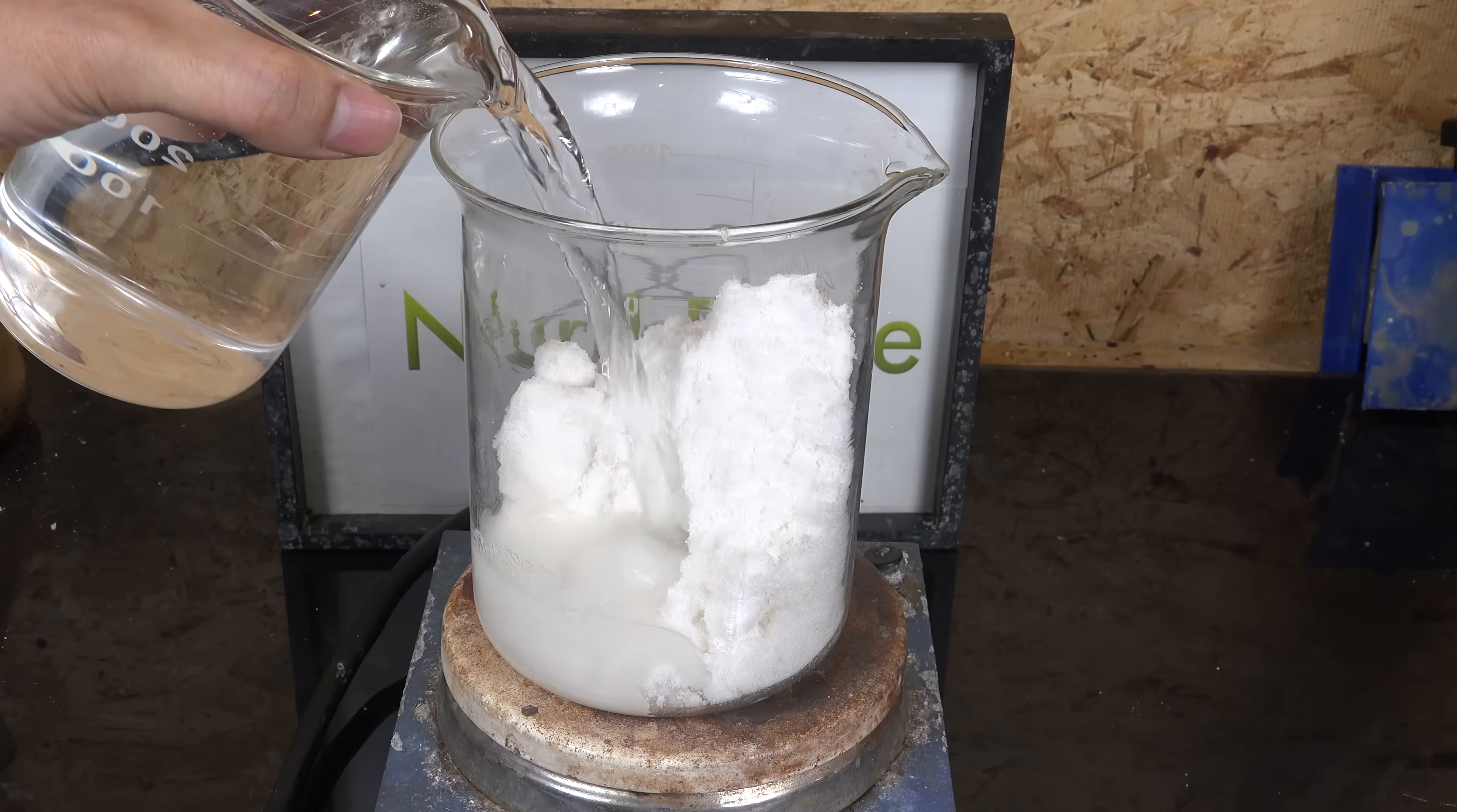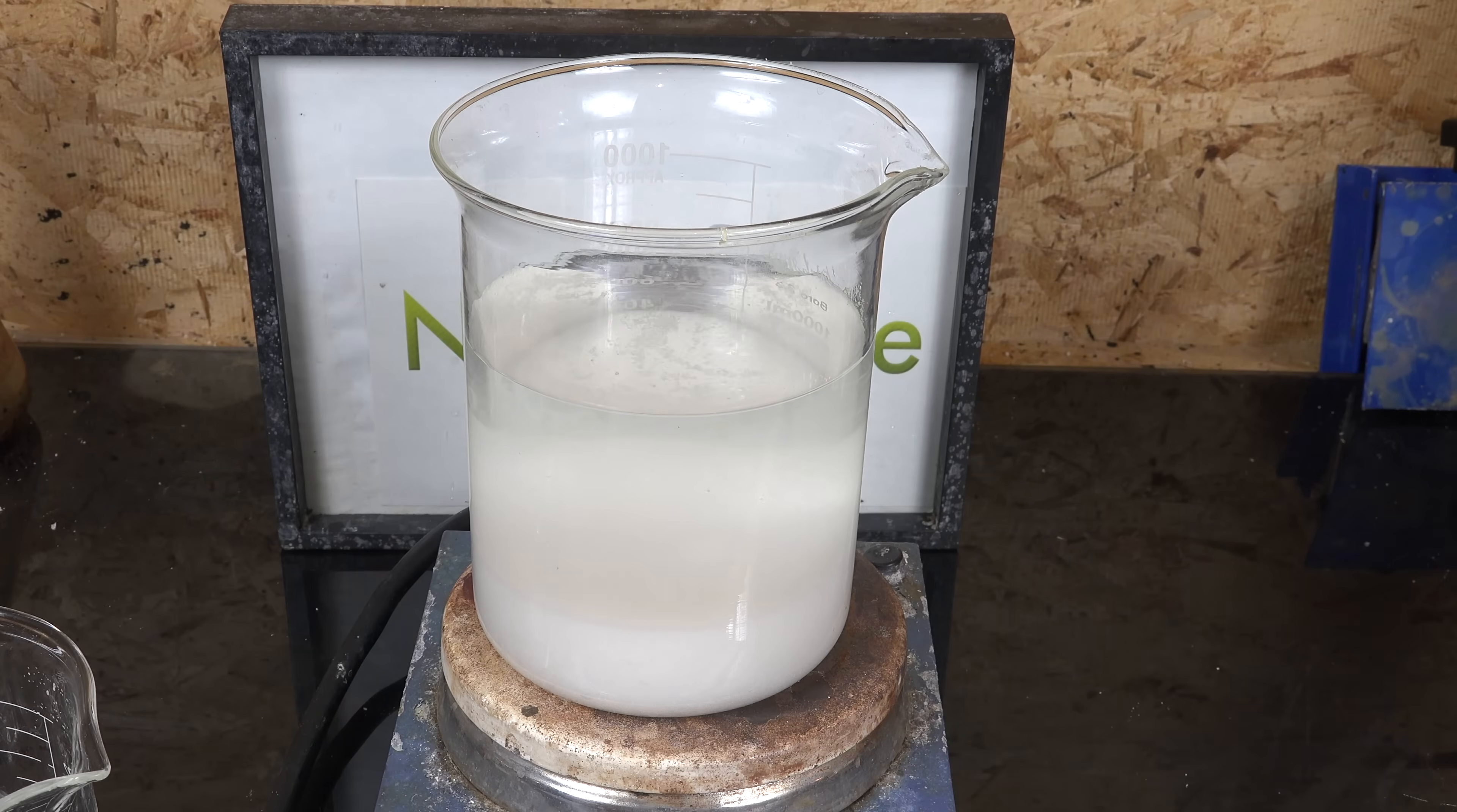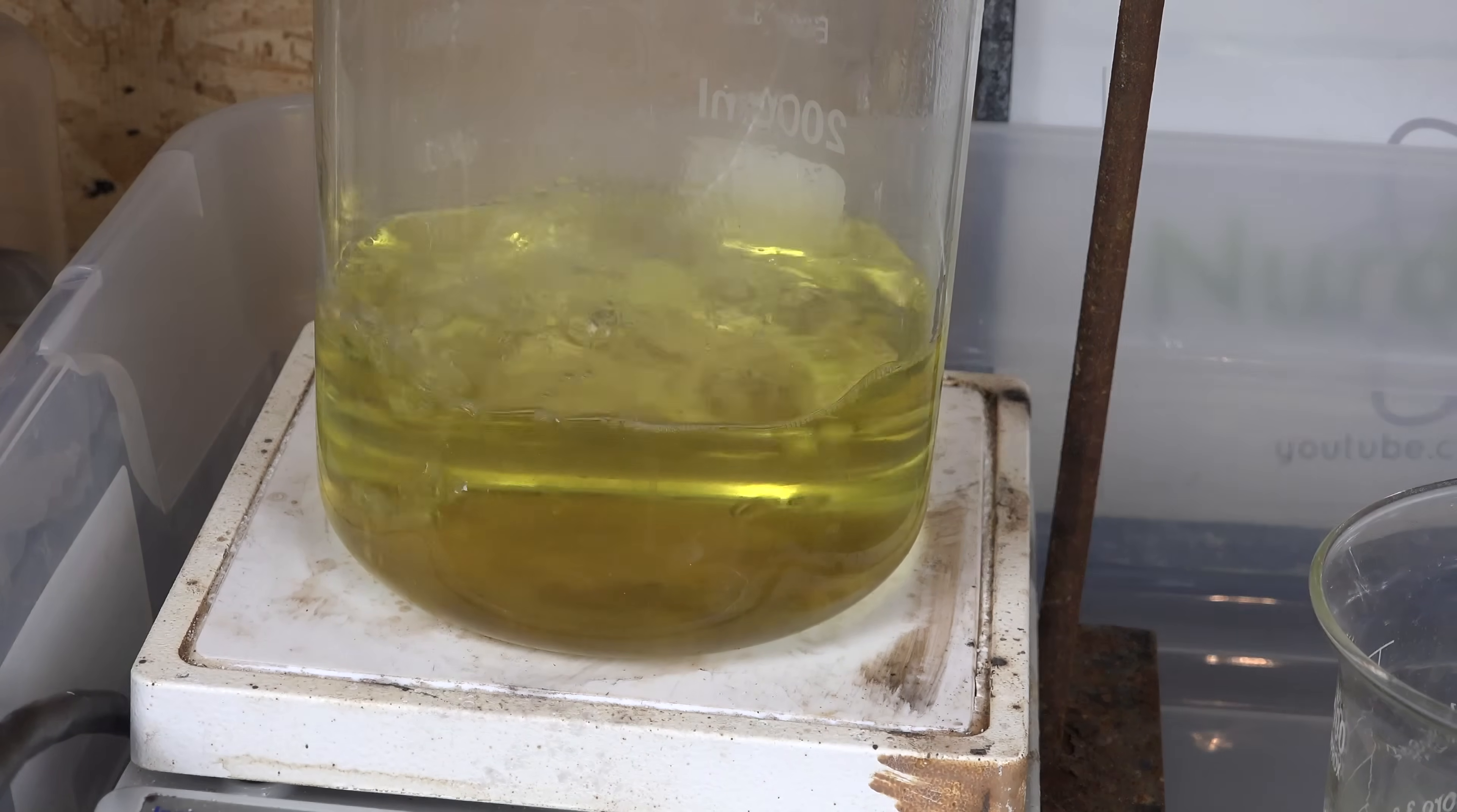But one thing we can do is use a much greater excess of reagents. So I tried again but this time I used 200g of oxalic acid rather than 150g. This much greater excess of oxalic acid pushes the reaction forward again.